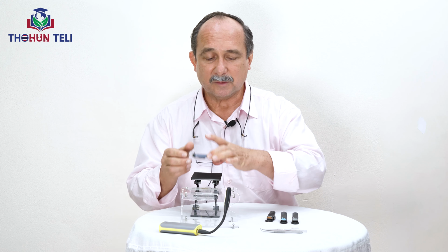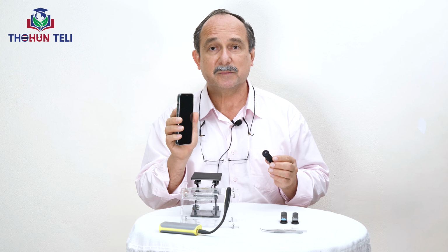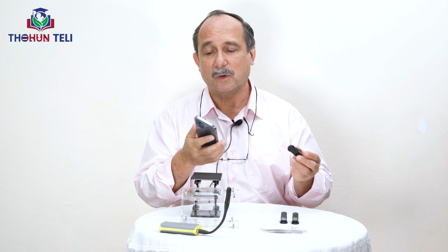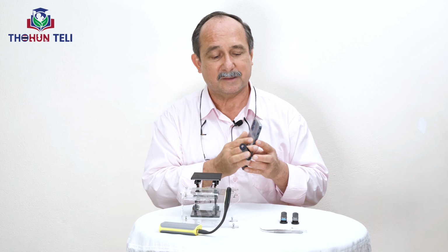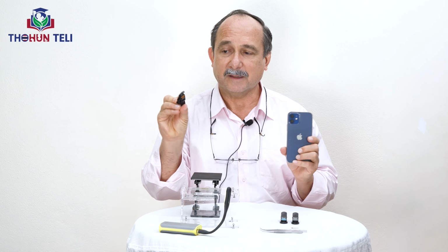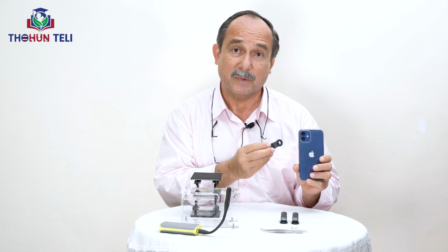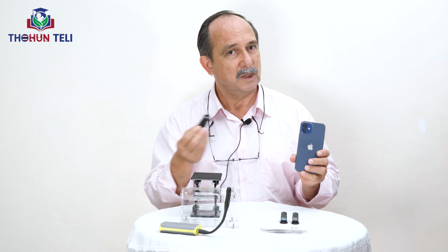The advantage is that you can take the picture and then see it in more detail and more relaxed later.